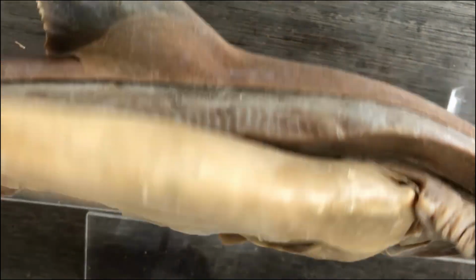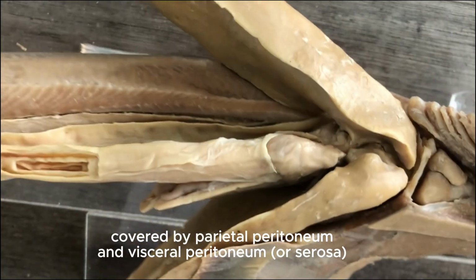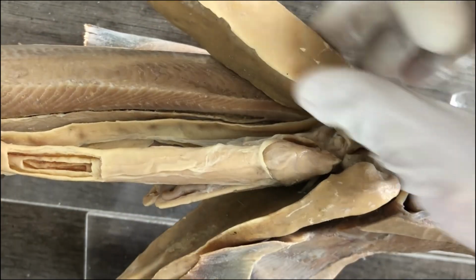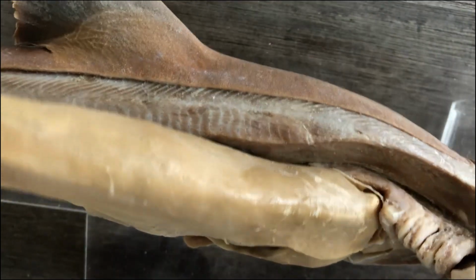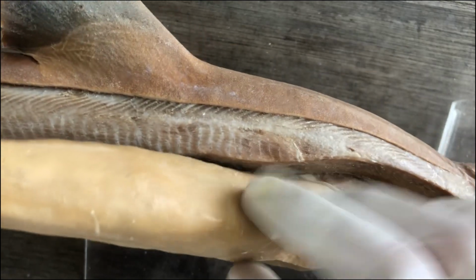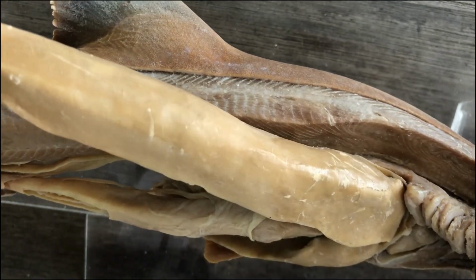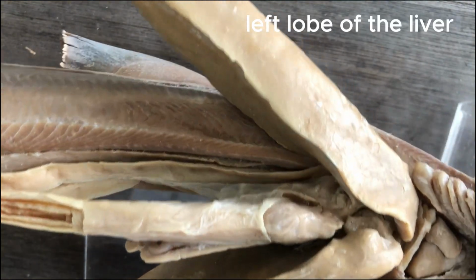Now we examine the more numerous contents of the pleuroperitoneal cavity. Most obvious would be these humongous structures, the liver. Right? And the liver of the shark is divided into the right lobe and the left lobe of the liver.